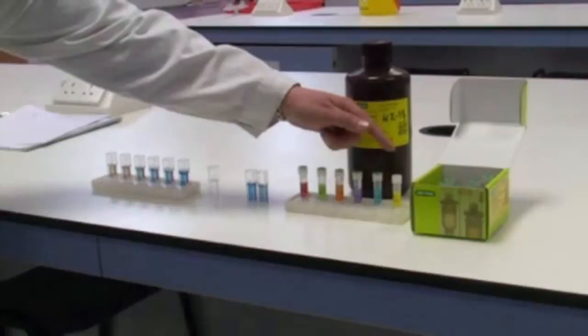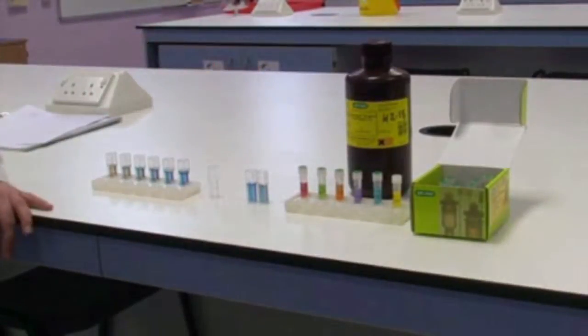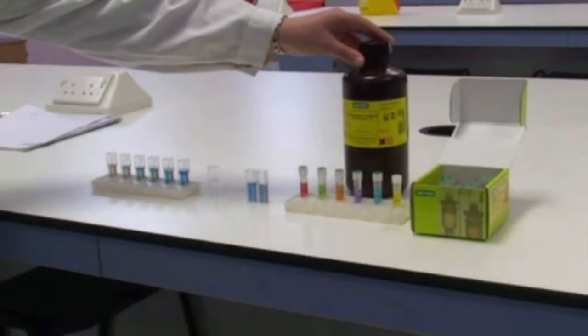Here are your range of standards. And also you will need the dye, Bradford Reagent, which comes here in a bottle like this.